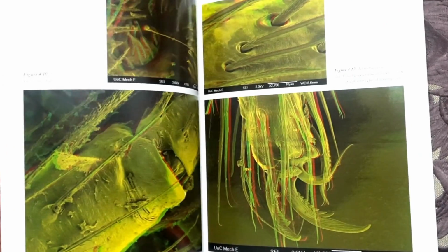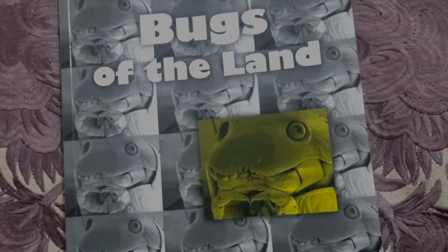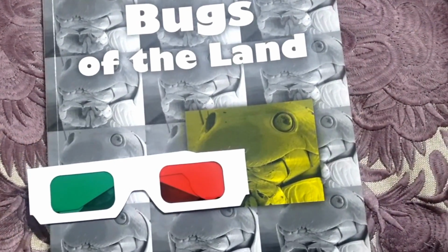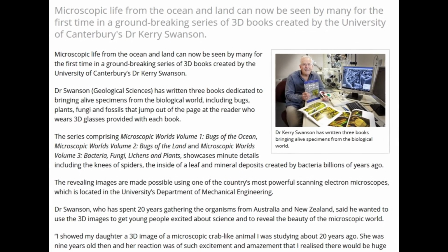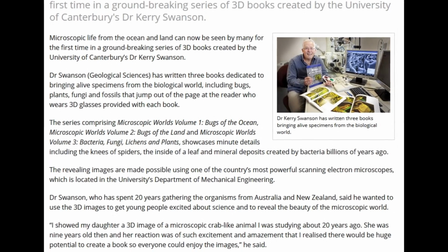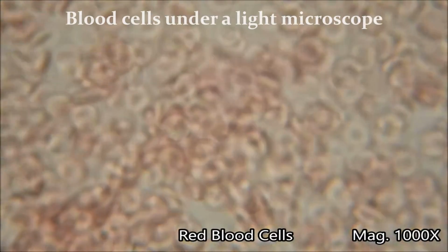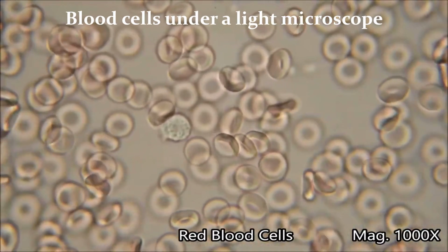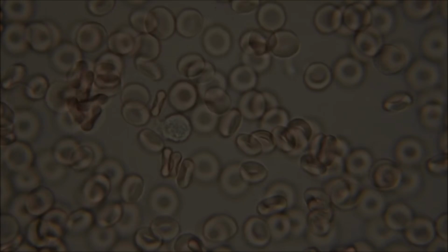I had the opportunity to work with those. Photographing an animal object for 3D representation is a lot of work because you have to find a good angle, and not make it too wide or too narrow. Since then, I really appreciate when people make 3D movies. It's such a hard job. Therefore, scanning electron microscopy has a great advantage. We can see much smaller things than in optical microscopy, and it can give us topography.